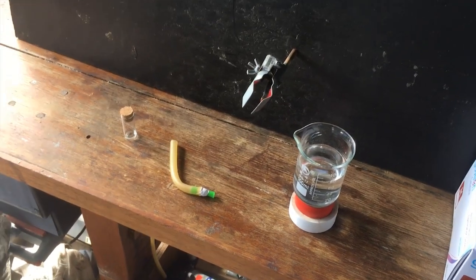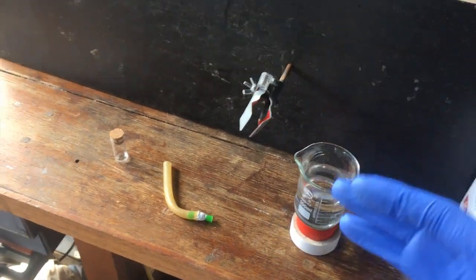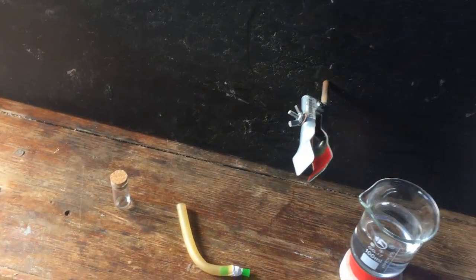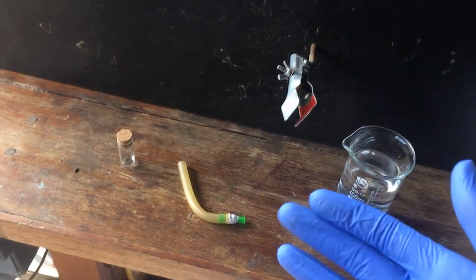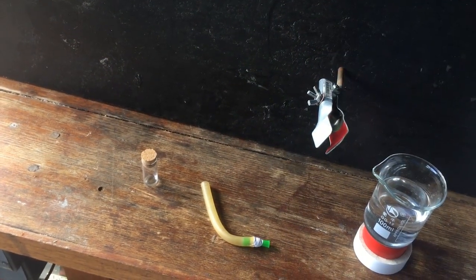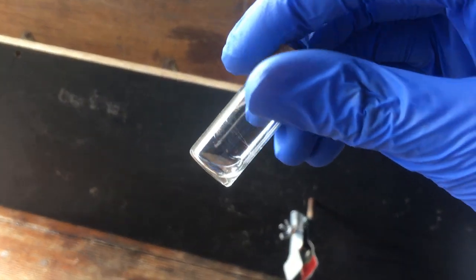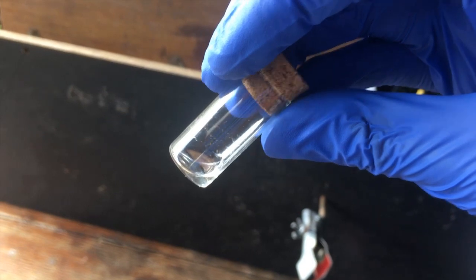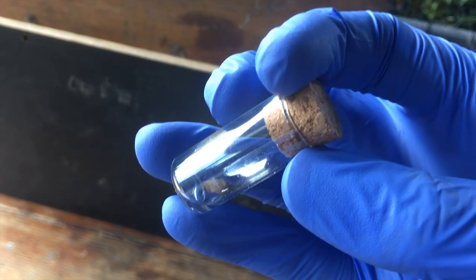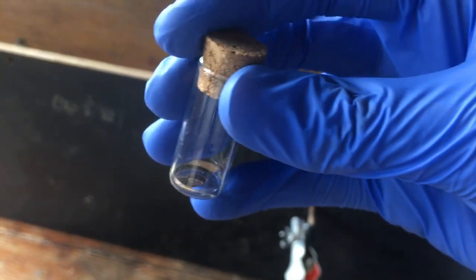If you've been watching the channel for a while, you'll know that I've had a project running for the last year and a half, the enrichment and purification of heavy water. We started with 20 litres of water roundabout, and over the last 18 months we've been electrolysing that down all the way till we've got whatever's left here, which is a bit less than half a milliliter of water. And theoretically this should be relatively pure heavy water, or water that contains deuterium instead of hydrogen.